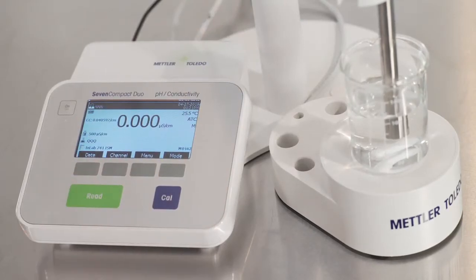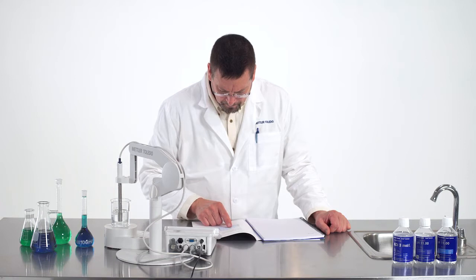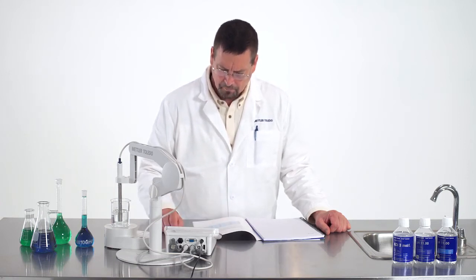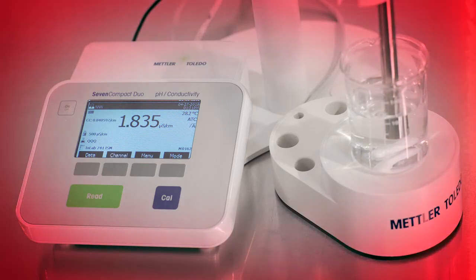Once the settings are adjusted, you must now take the temperature of the water and a non-temperature compensated conductivity measurement. Stage 1 of this method requires you to compare these completed measurements to a temperature conductivity limits table to ensure that the measured conductivity is below the temperature conductivity limit at the measured temperature. Misinterpretation of the table at this stage can lead to erroneous pass-fail results and even failed audits. This sample did not pass the first step, so we must proceed to Stage 2.